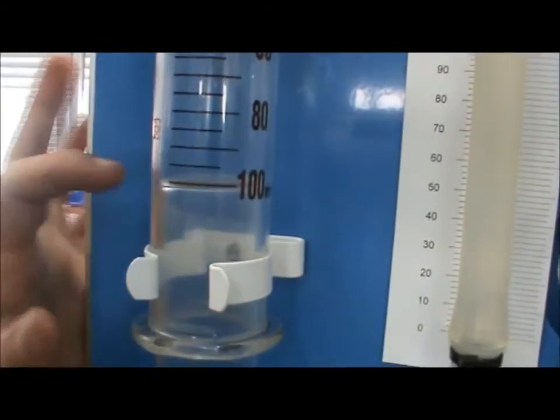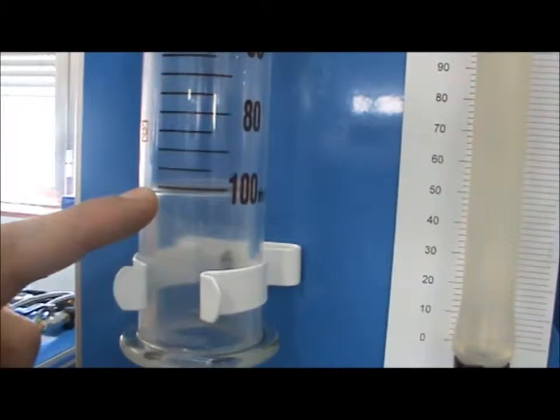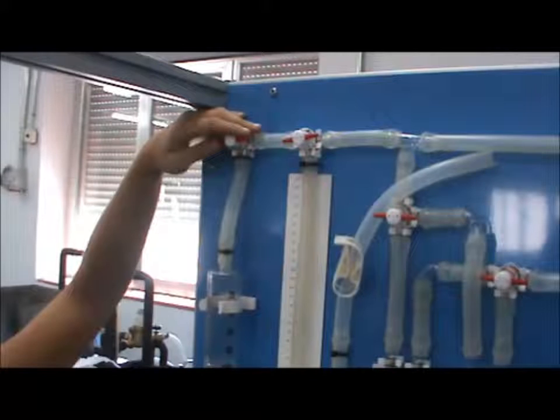Take the final sample of 100 milliliters, and be careful to note how the volume is measured with reference to the plunger in order to maintain consistency with measurements. Close VT3 to isolate the sample and let it stabilize for approximately 10 seconds.